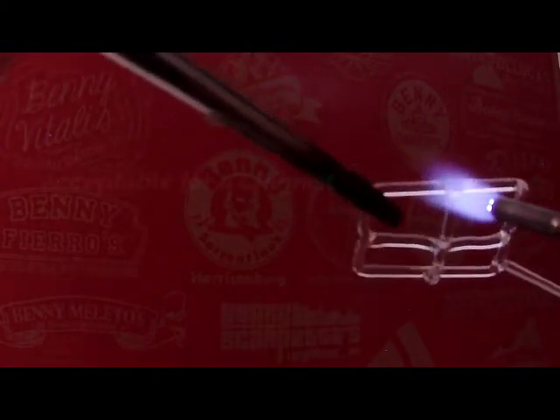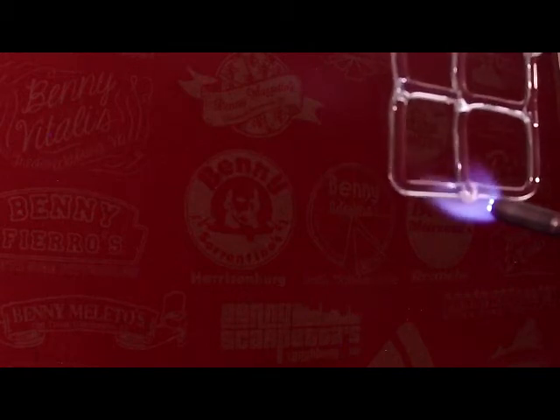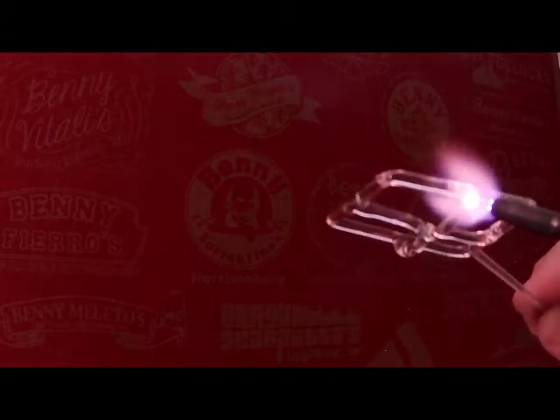This would be an acceptable weld. But what I'm going to do is heat it strongly so that the two pieces of glass do more properly fuse together. It's definitely not a cold seal at this point, but the uniformity of the weld could be improved. I could use, again, the tweezers to give it a little squish, but what I'm trying to do in this exercise is stick with the torch and gravity for shaping the glass as much as possible after the initial connection points were made.